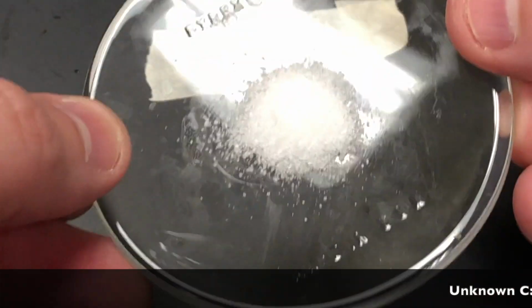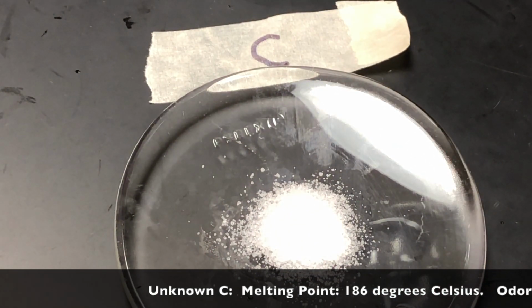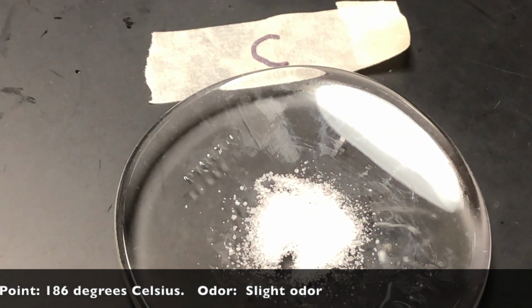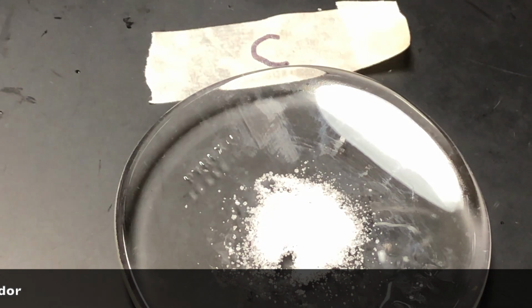As you observe unknown C, you'll notice it does look like it might be crystalline, but it's really hard to tell sometimes. Just make your best guess. Again, check the information at the ticker, and as you can see here, it does not conduct when it is a solid.